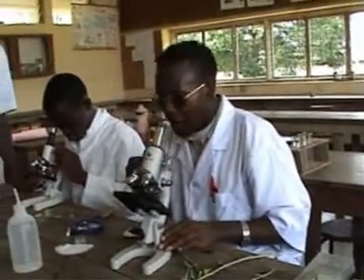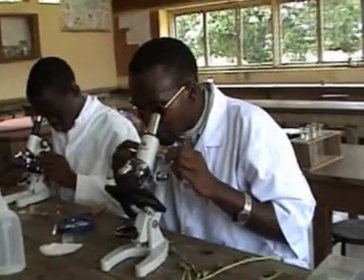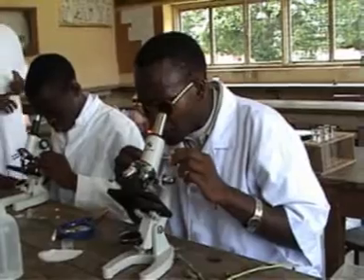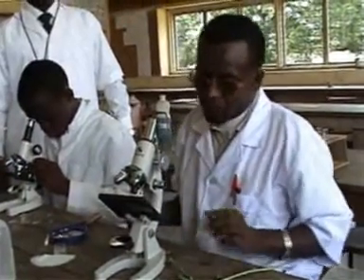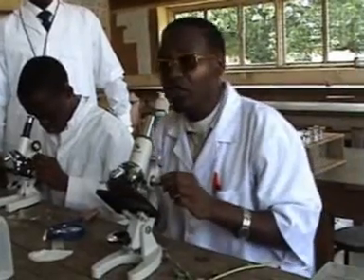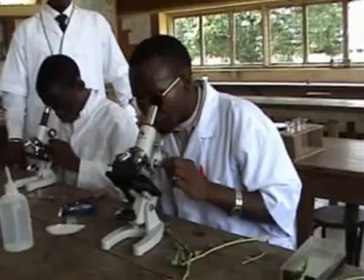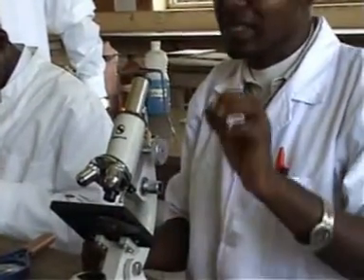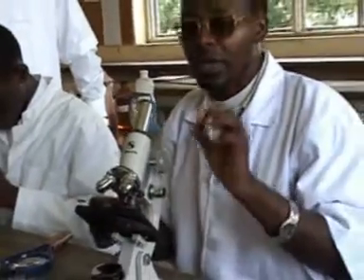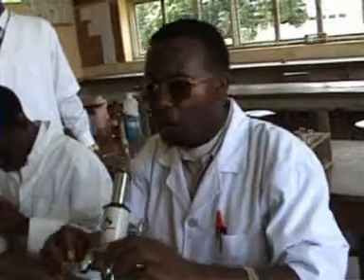You can view it with your one eye, and you take it up gradually. You take it up gradually. As you are taking it up, now I can see a few cells. So when I now see a few cells which are not very clearly resolved, I will then use the fine adjustment. So as I'm using the fine adjustment knob, I will realize that it is gradually resolving my preparation, and there's a time I will see the cell walls very, very distinct.